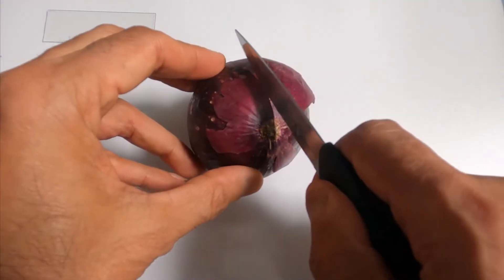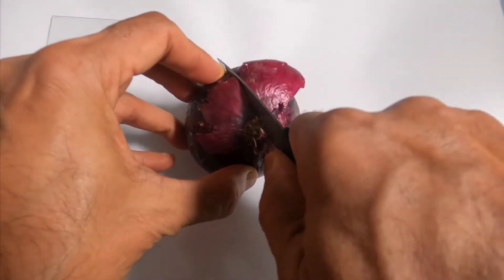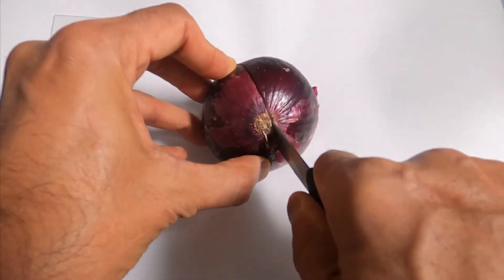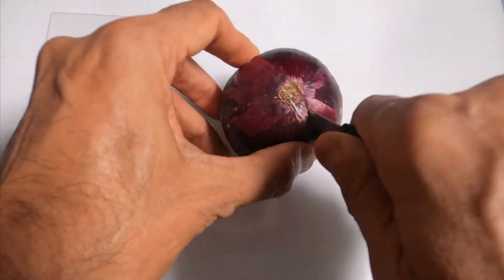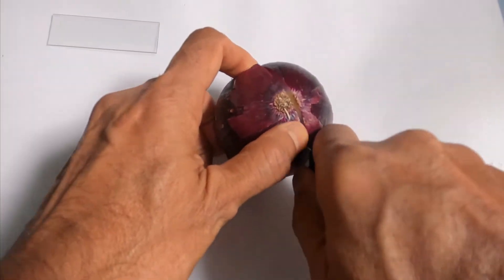In order to observe the onion cells under the microscope, I took a small size onion and cut it into small pieces with the kitchen knife.